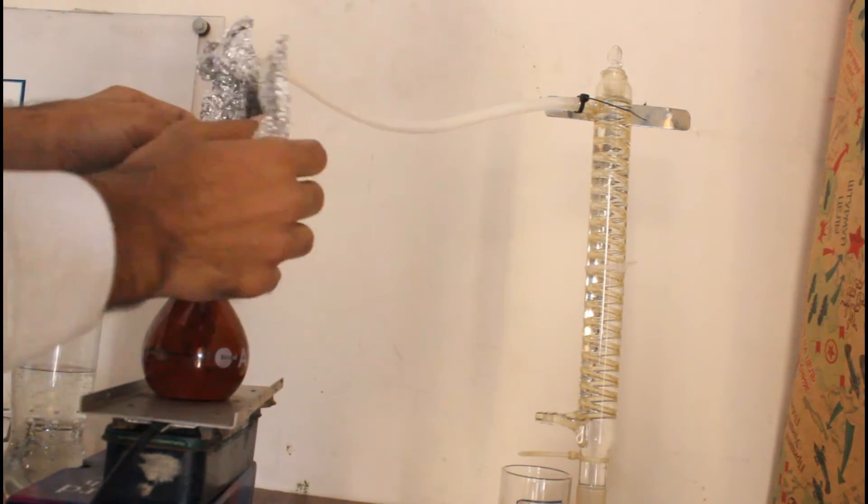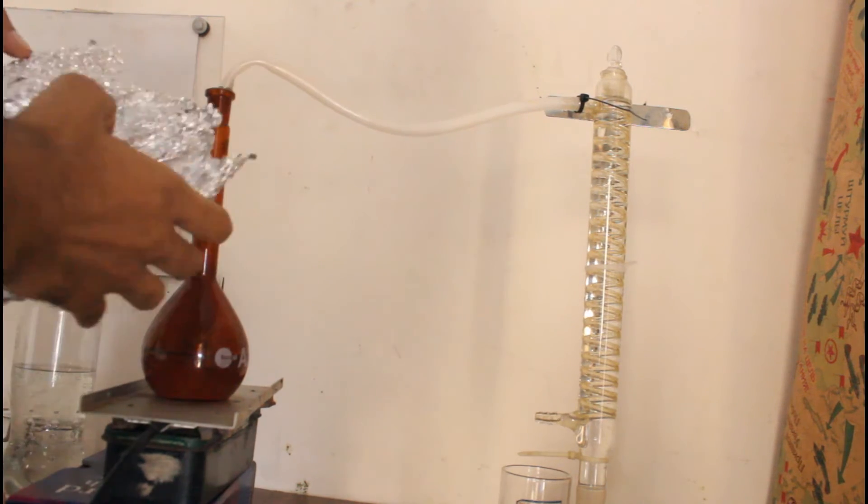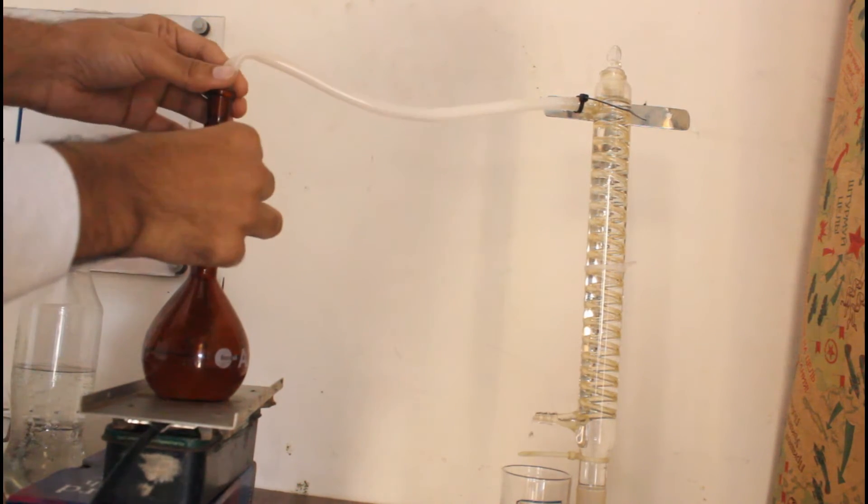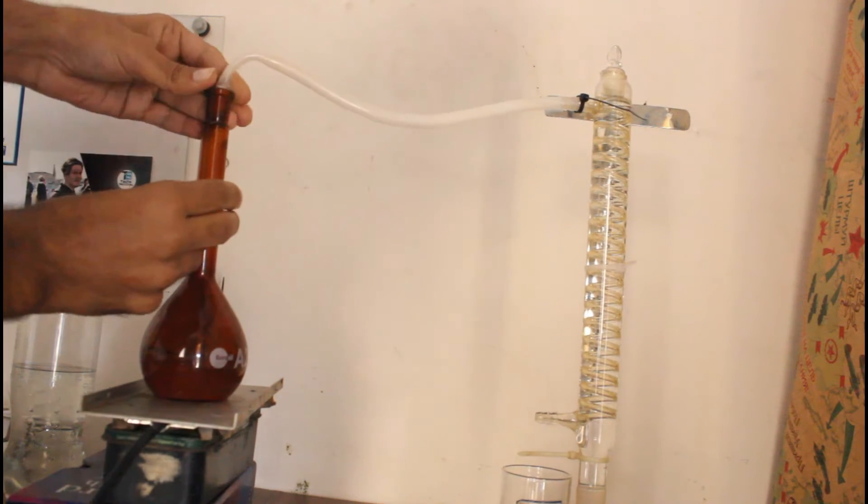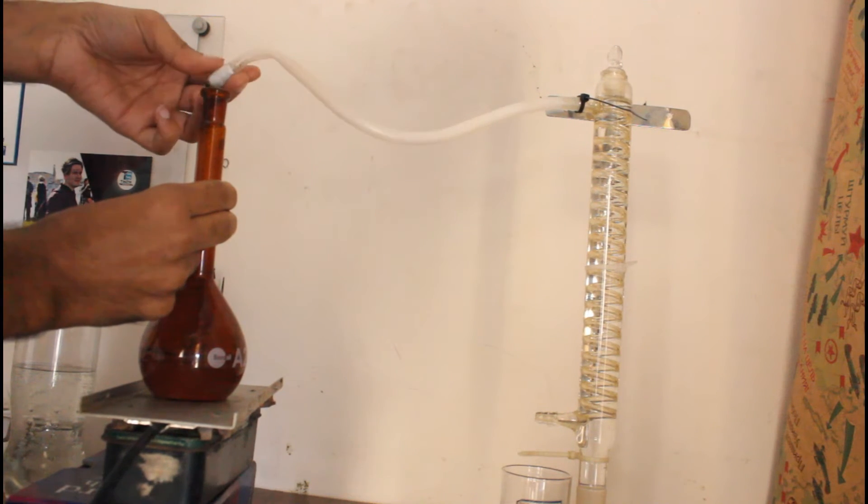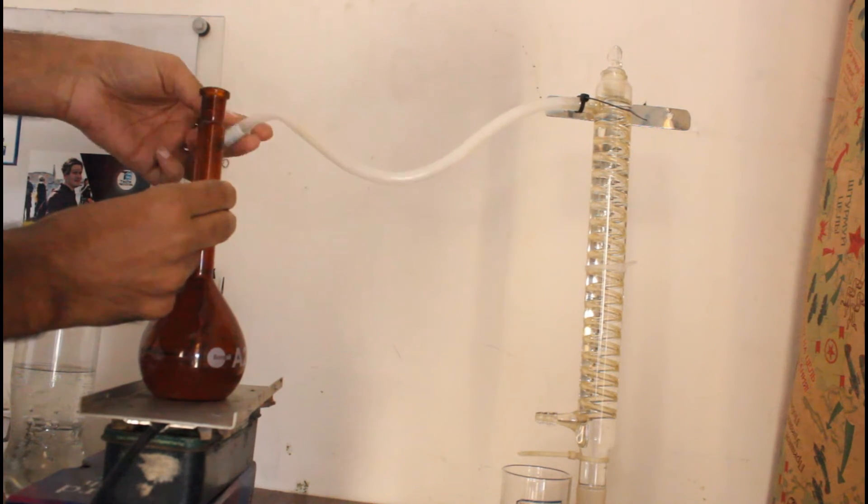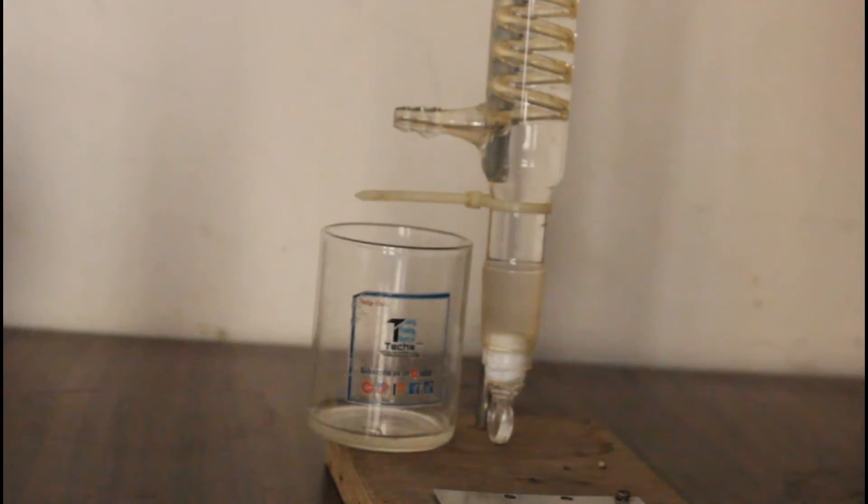Okay, now we can remove the setup and let's see the property of the liquid we have collected. Okay, some of the liquid is still in this tube. Okay, we got this liquid collected.